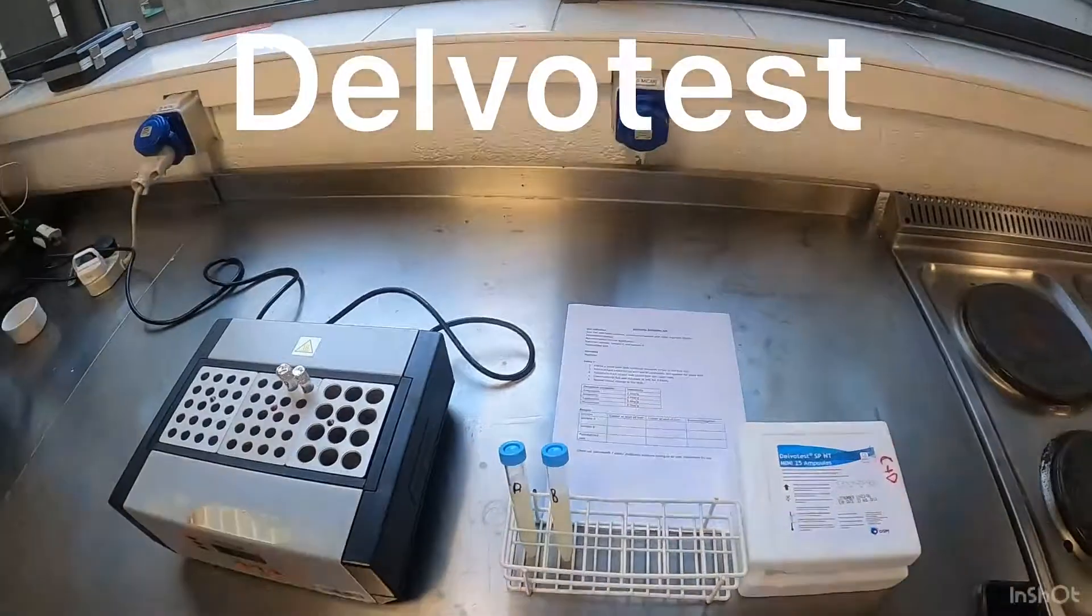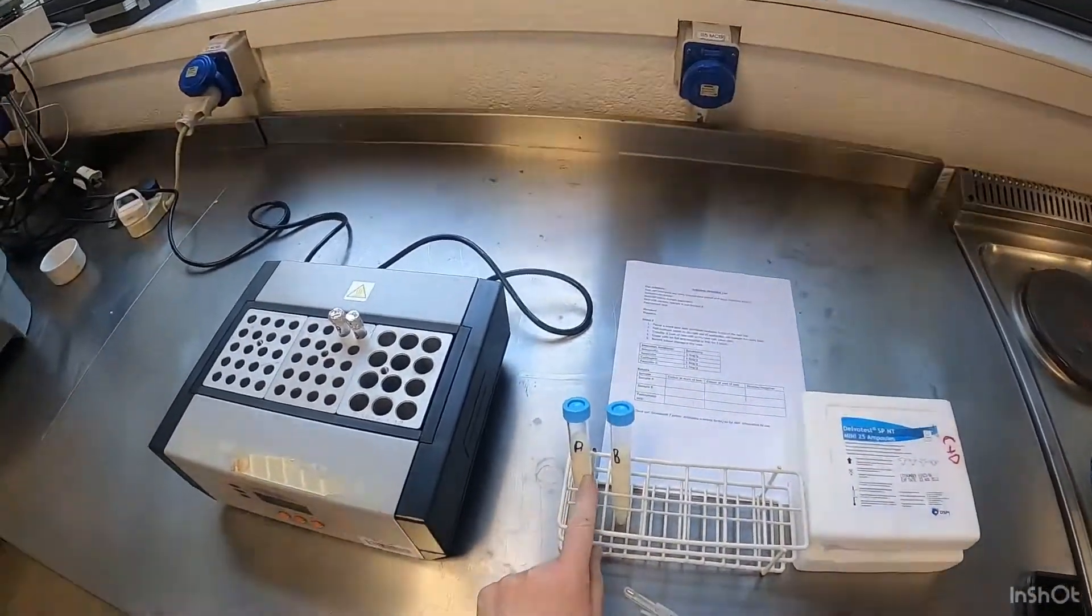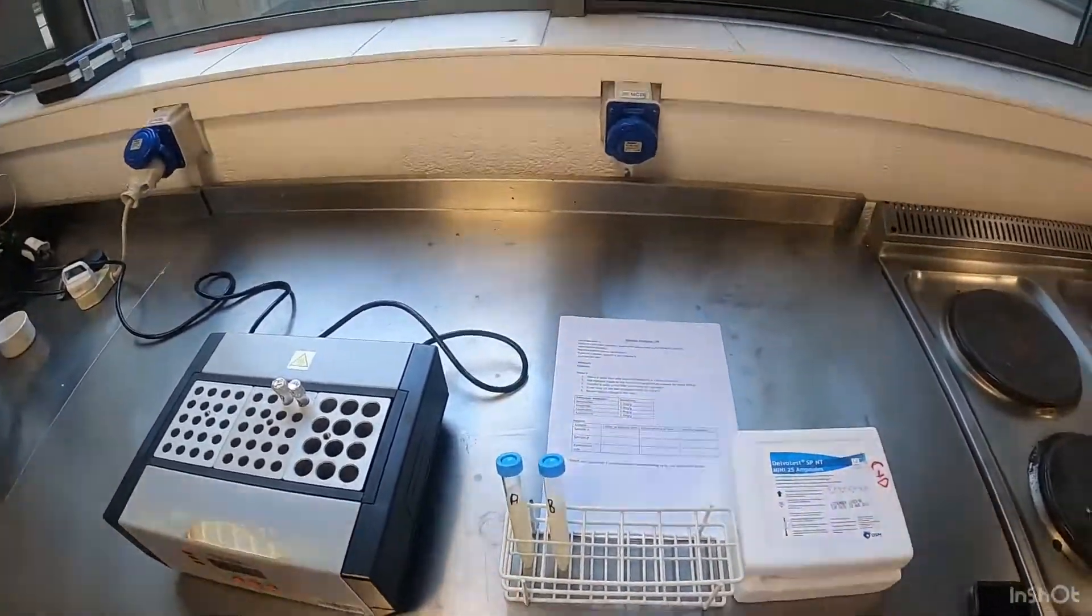Okay, so we're going to have a look at testing two milk samples, sample A and sample B, for antibiotics.